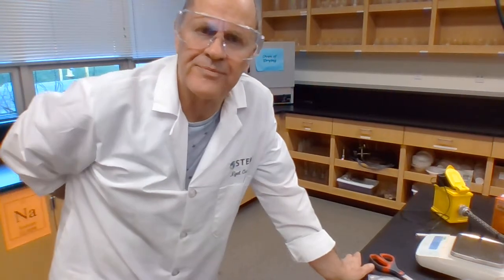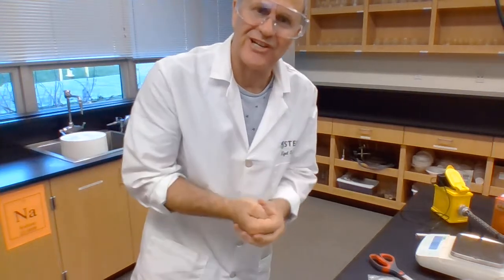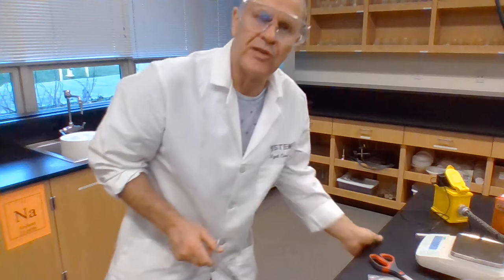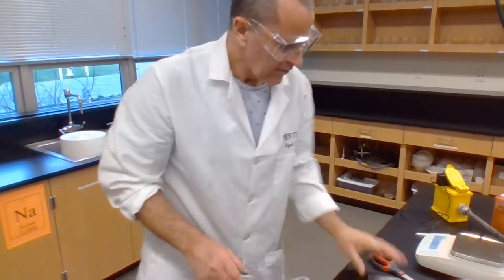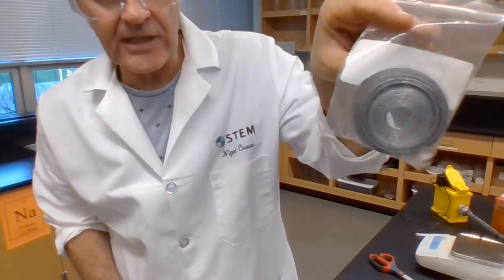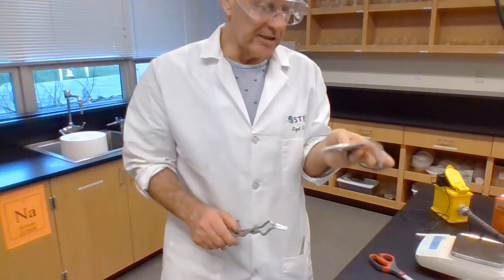Another in our series of quick and easy labs, so I can make some videos in a hurry and you can do lots of lovely calculations using periodic tables, molar masses and formulae. So what I've got today is, well, I'm going to supply one reactant, and that's magnesium metal, Mg, solid.